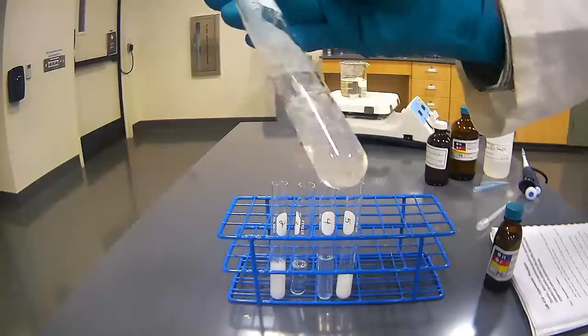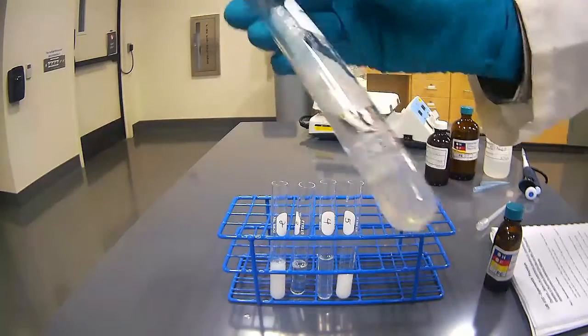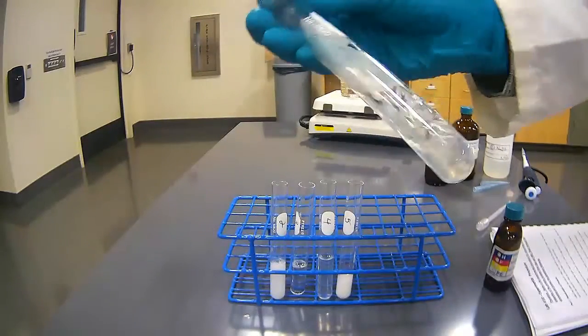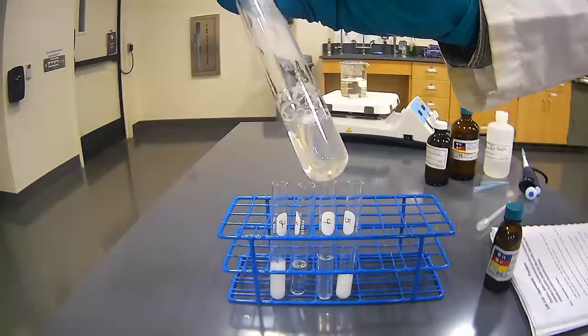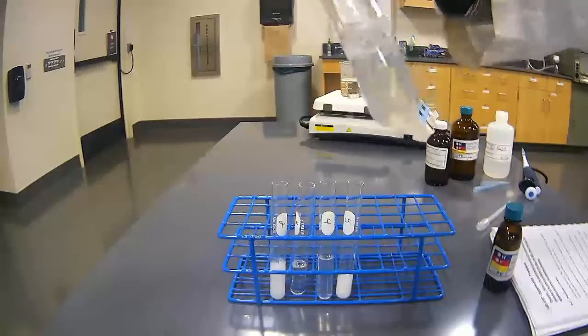Kind of looks like what an egg white would look like if it got heated up. So I'm seeing some white particles there. I see also some particles or white substances on the side where it got heated as a result of that. So a nice little chunk in there.